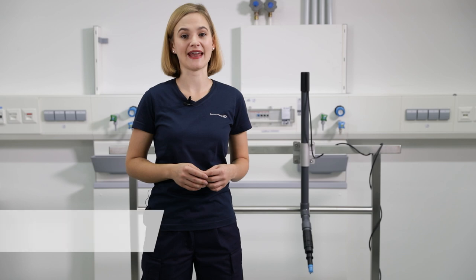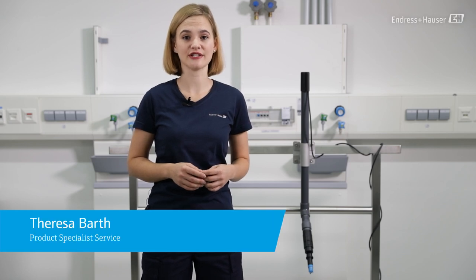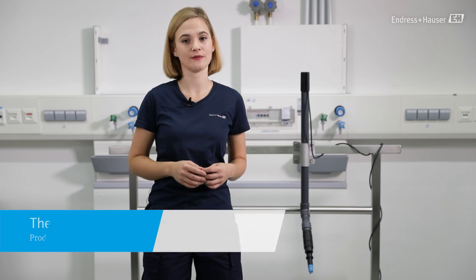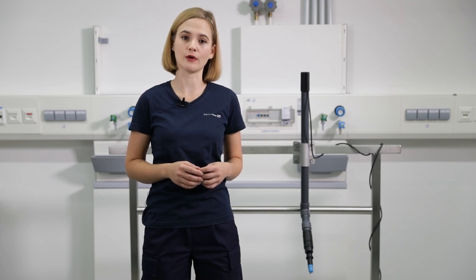Hey, I'm Teresa and I will show you how to calibrate our digital total chlorine sensor CCS120D. With the CCS120D you can reliably measure total chlorine in different water applications, for example in wastewater.